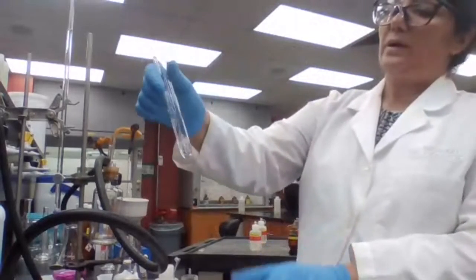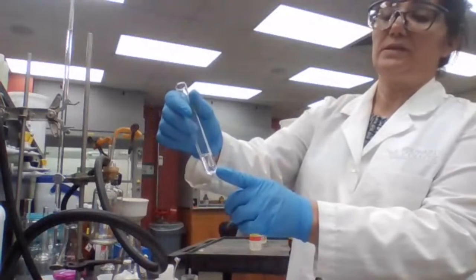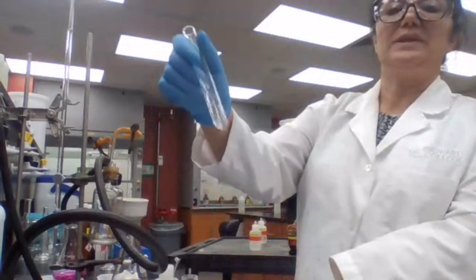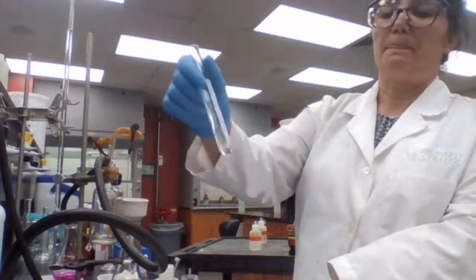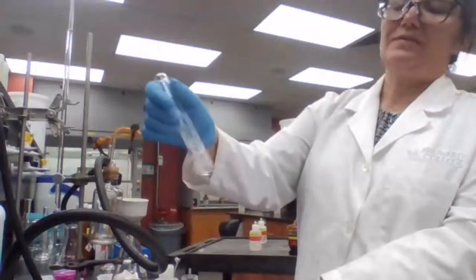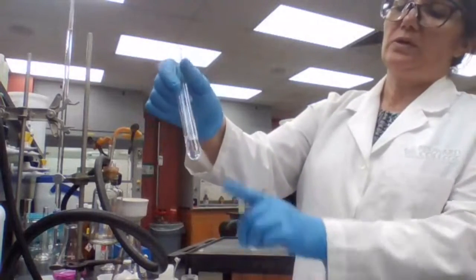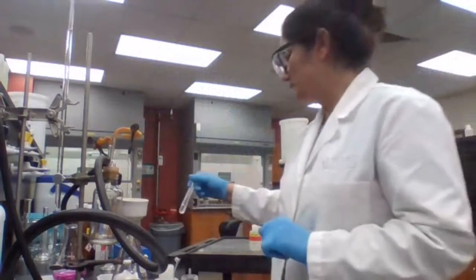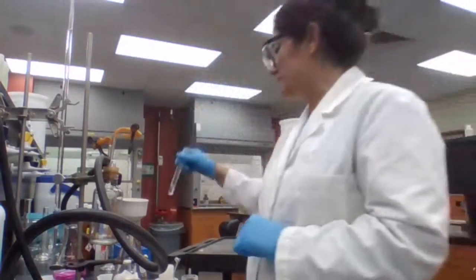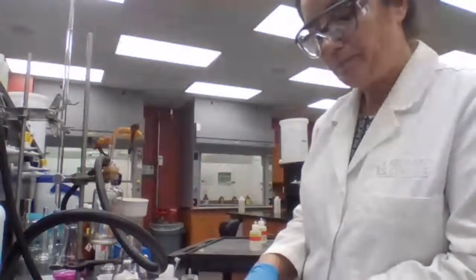Okay. Okay, Tollens reagent, the unknown did not show any reaction with the Tollens reagent. I was preparing my Tollens reagent and so no reaction with the Tollens reagent. That's for the Tollens reagent. For unknown B, no reaction. Please record it. So we are moving to the next part.